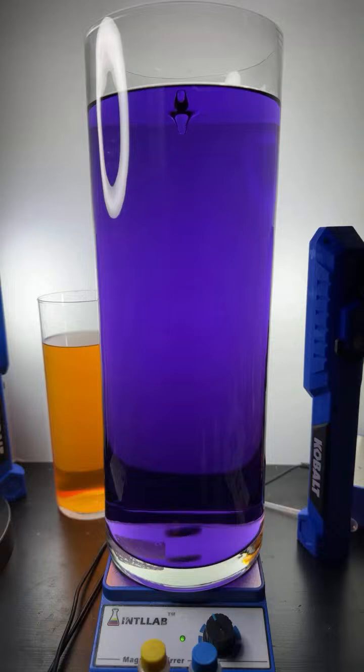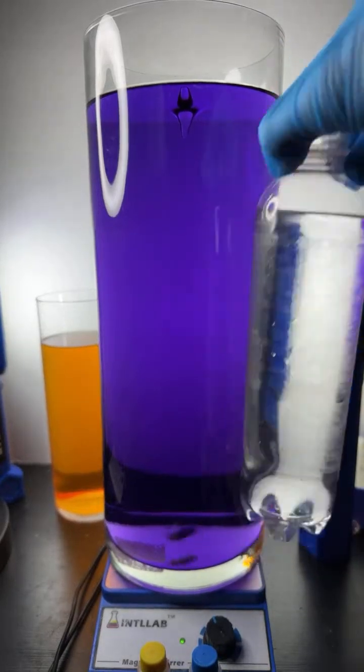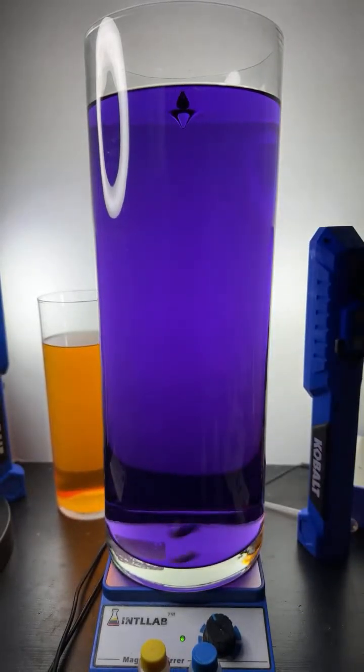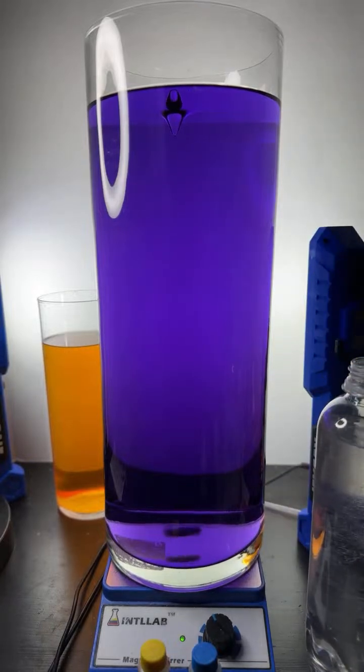We'll pull this out. I'm going to have to readjust the camera so that we can, look how tiny this bottle is in comparison to the... Can I do a precipitation reaction? I can, but I don't have it ready for you. So sorry about that, Malik. I do not have materials ready for a precipitation reaction. Let me get this big honking thing off of here for a bit.